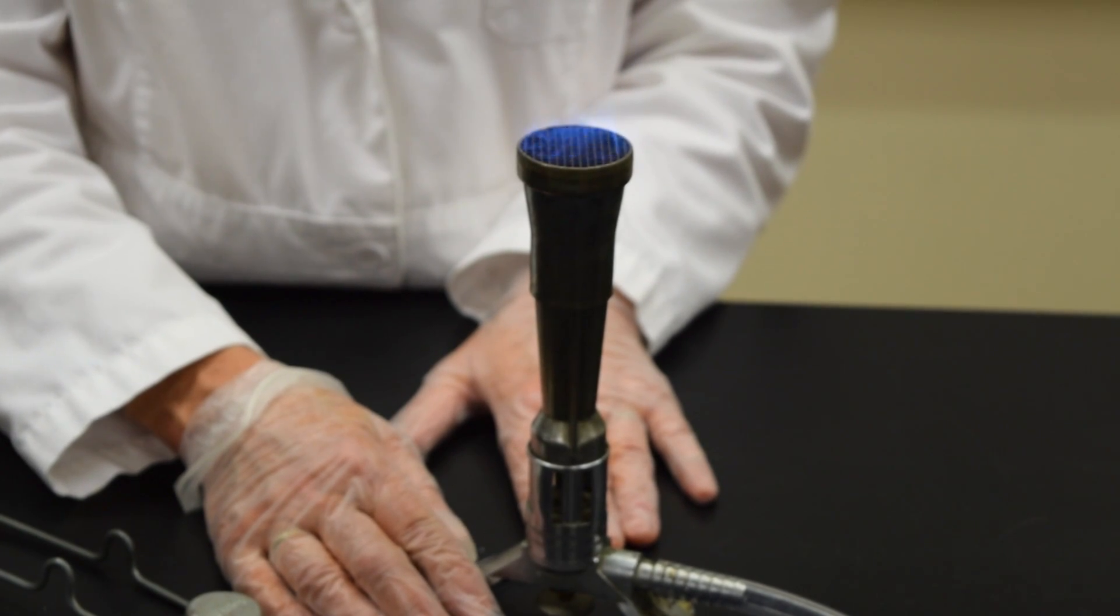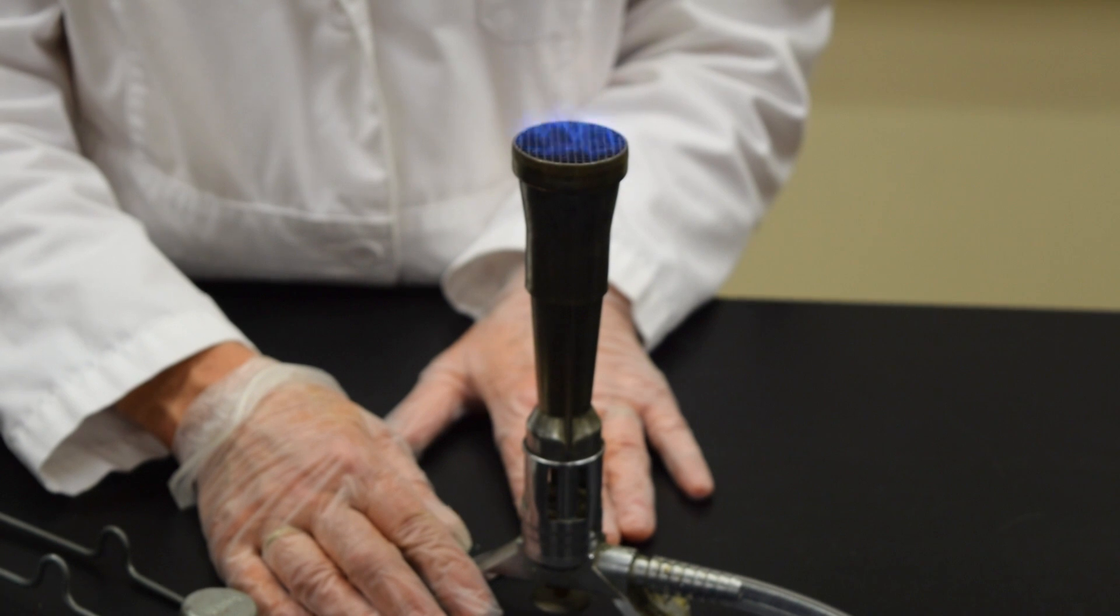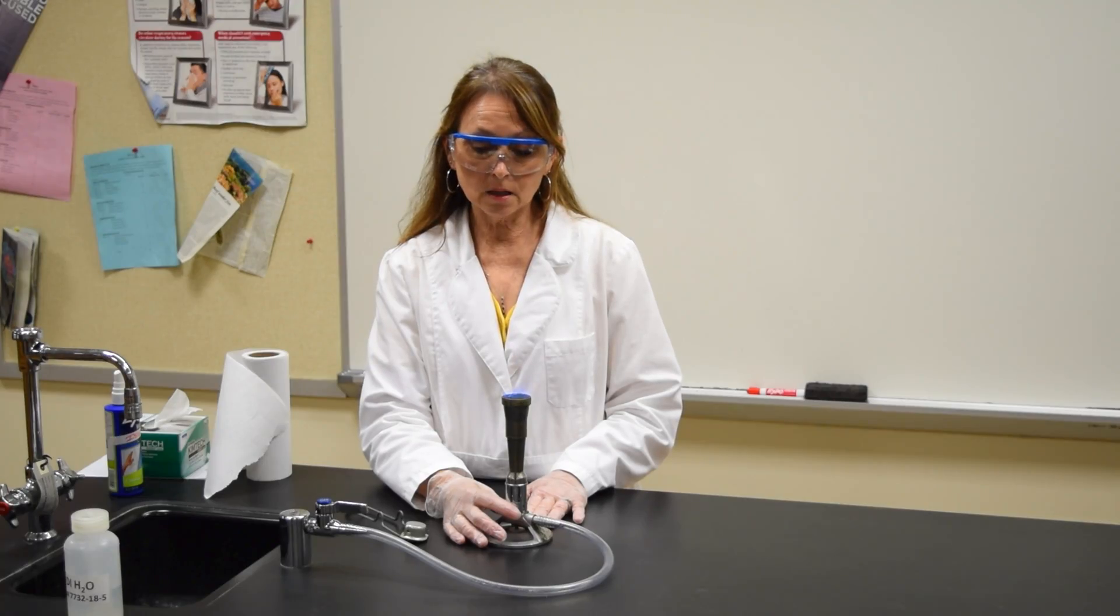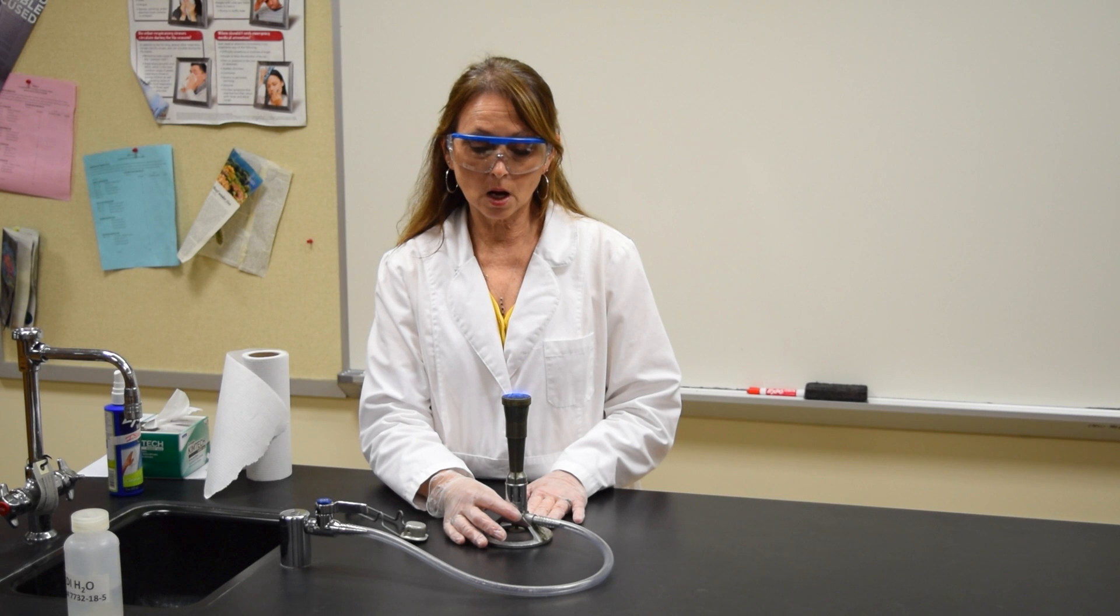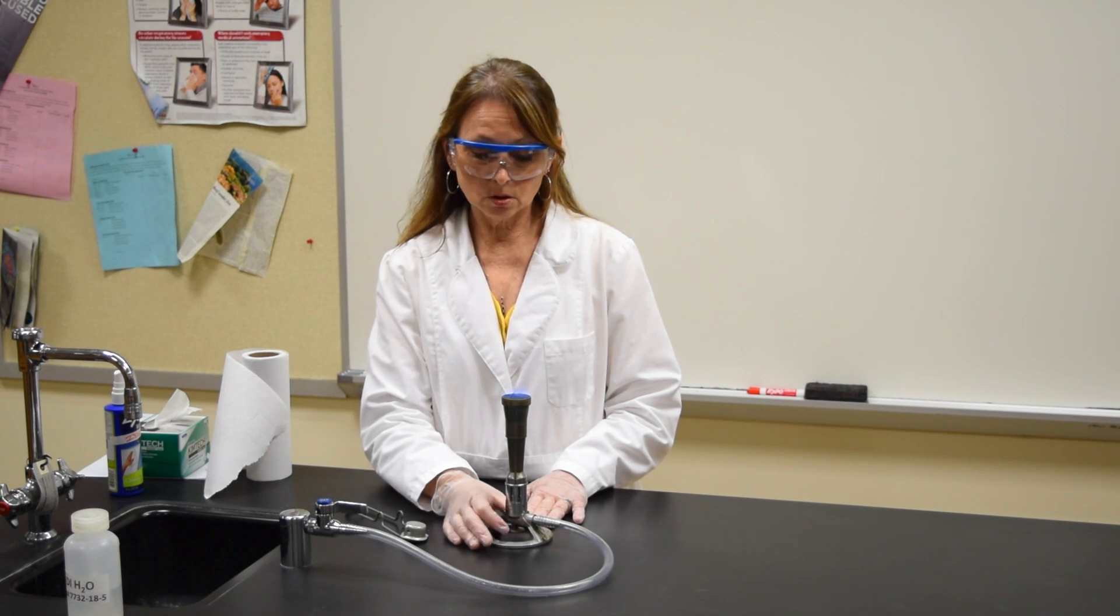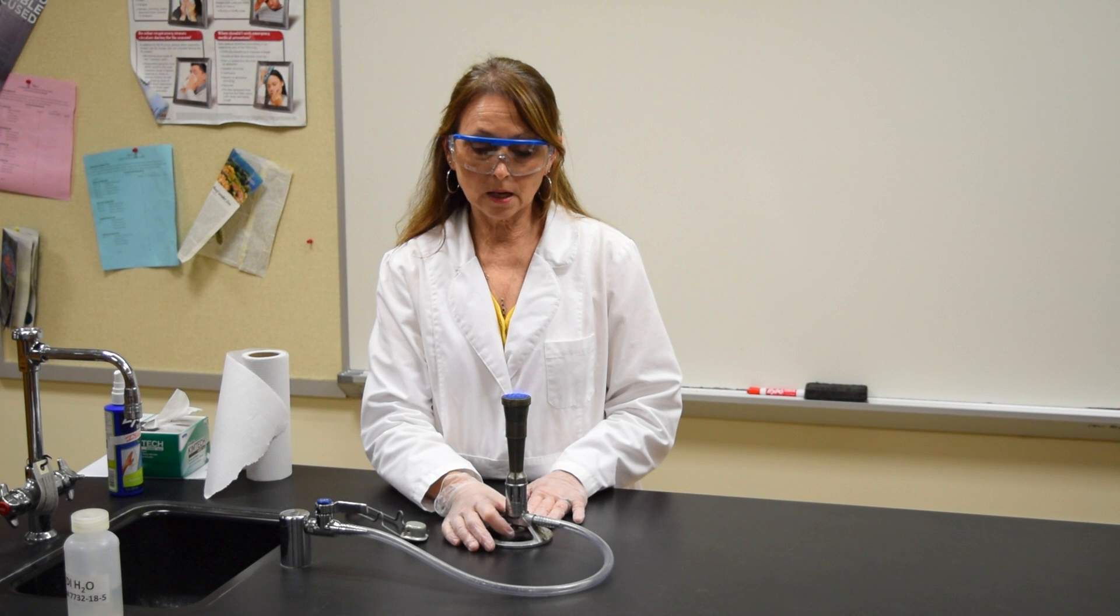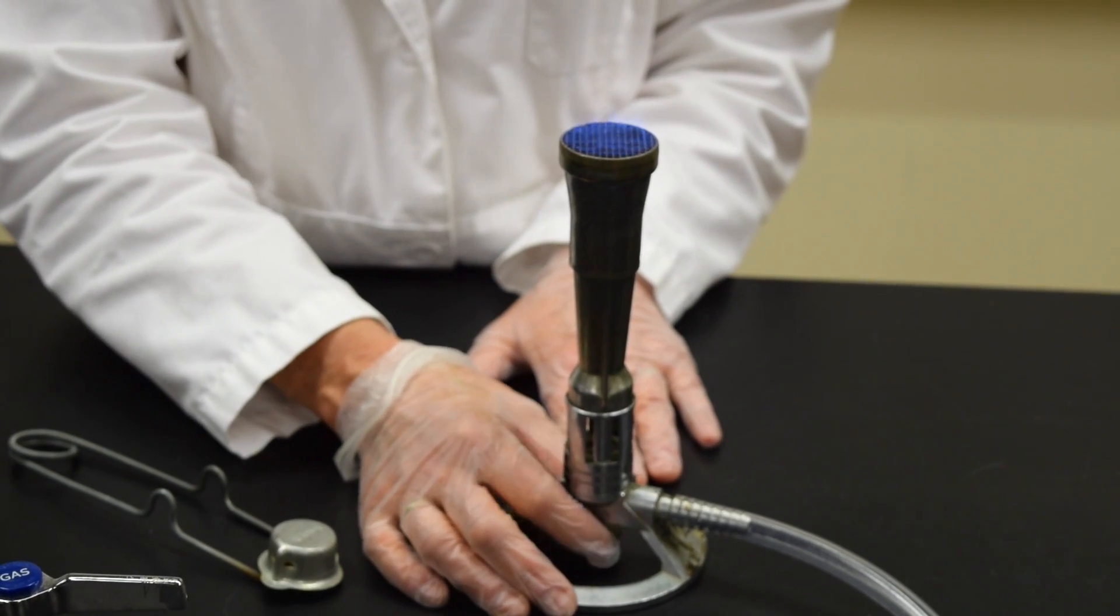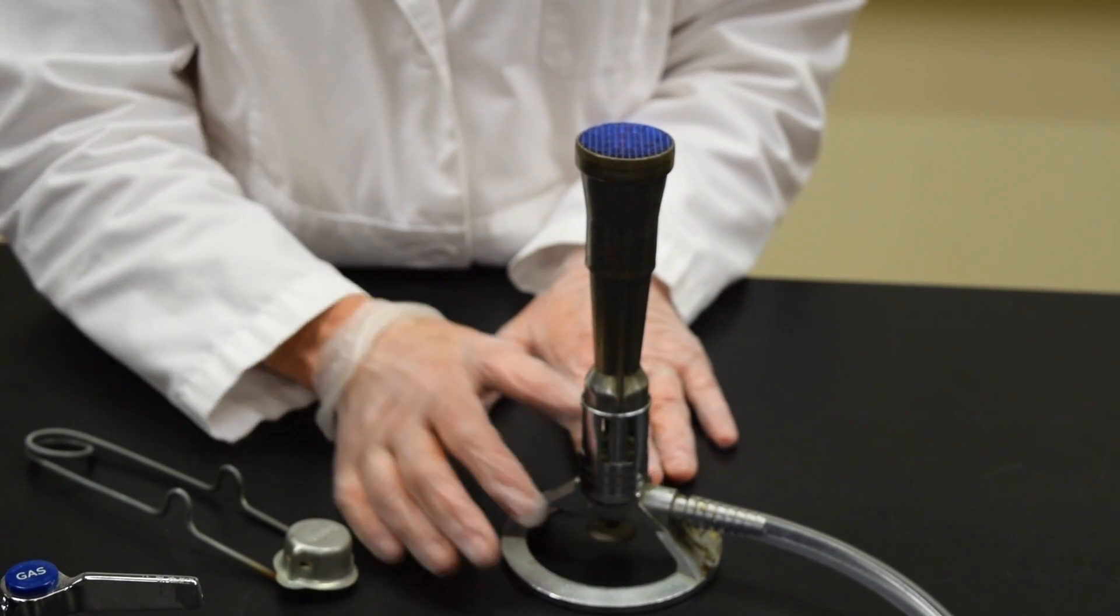There's more yellow color. You want the flame of the Bunsen burner to be a medium height with minimal hissing and minimal yellow color. To reduce the oxygen going through the Bunsen burner, you rotate the wheel in a counterclockwise position. And the height of this flame would be perfect for your experiments.